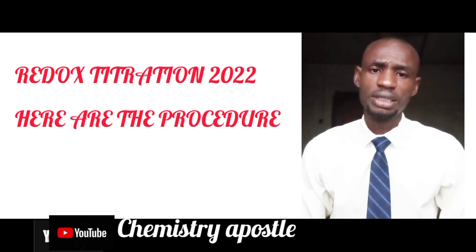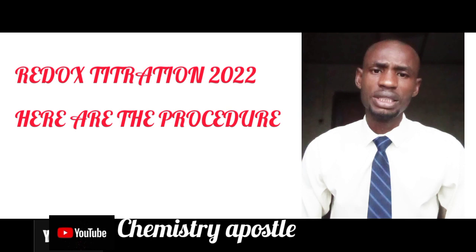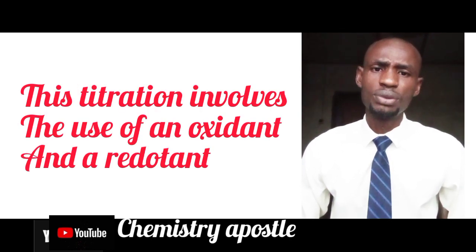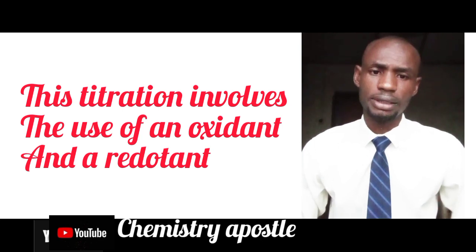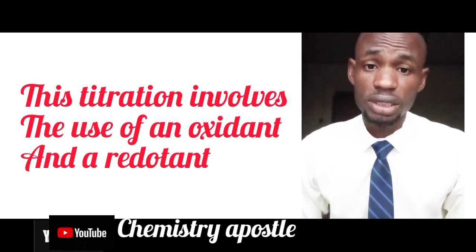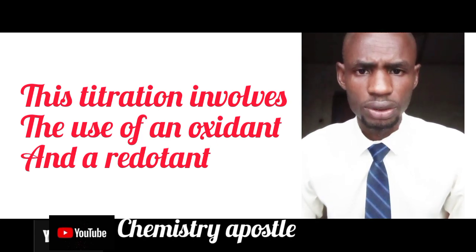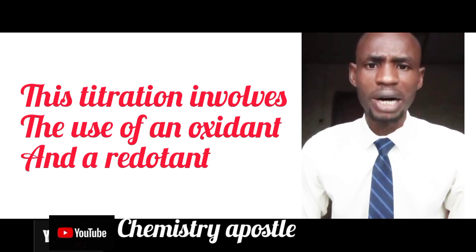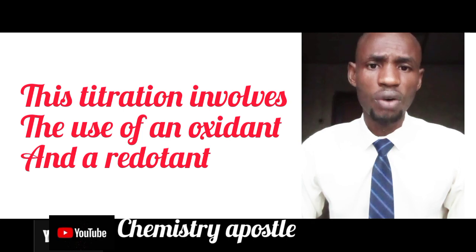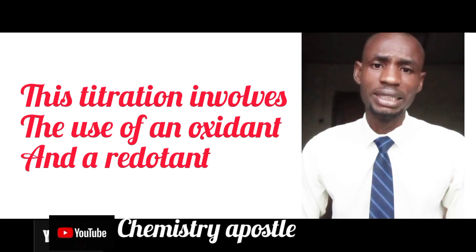My dear lovely students, in this video, I want to tell you that redox titration is a titration that involves a reductant and an oxidant. WAEC Practical 2022 is redox titration, and that means that we are going to have a reductant and an oxidant. It's not a conventional normal titration that will use acid and base.